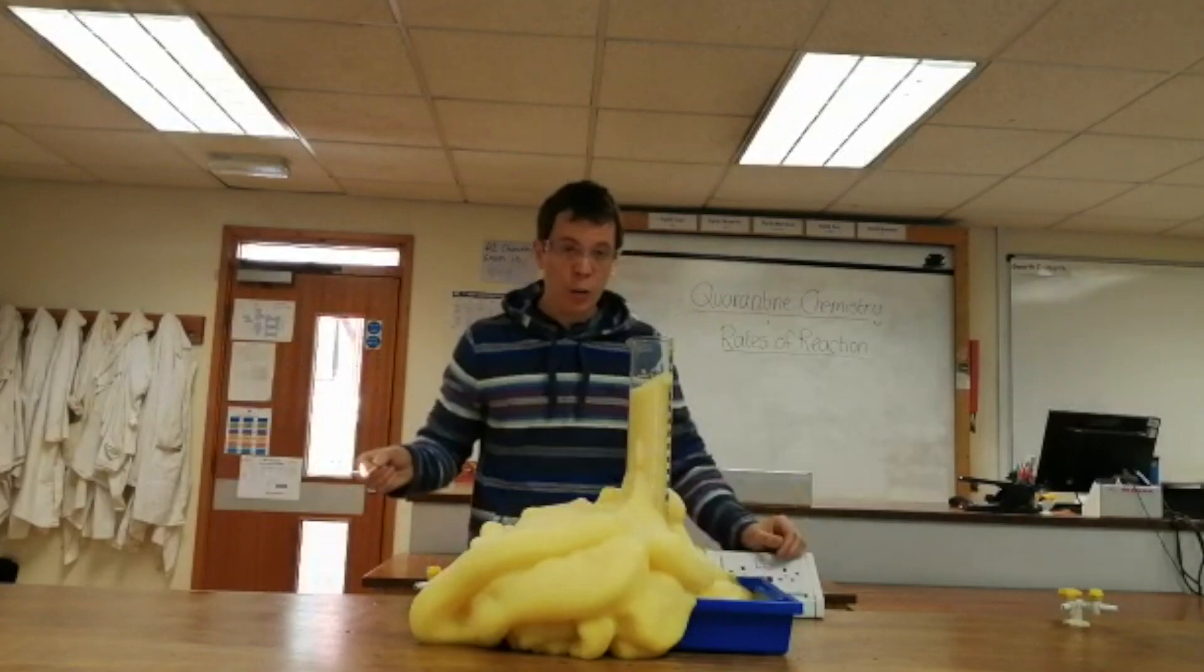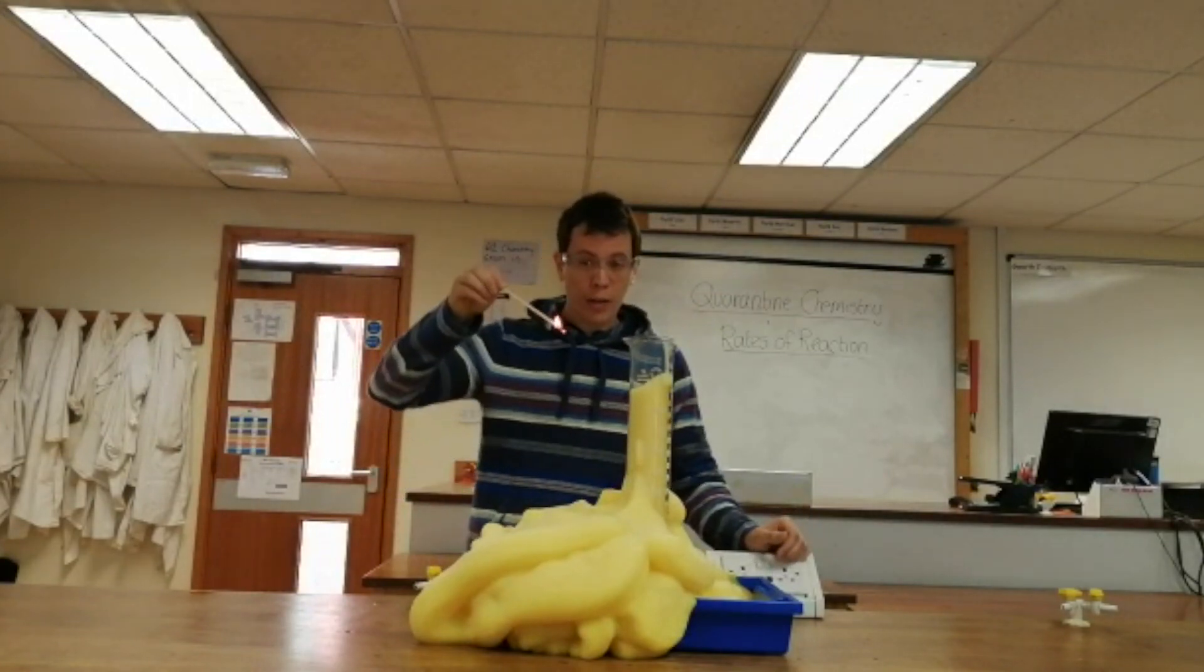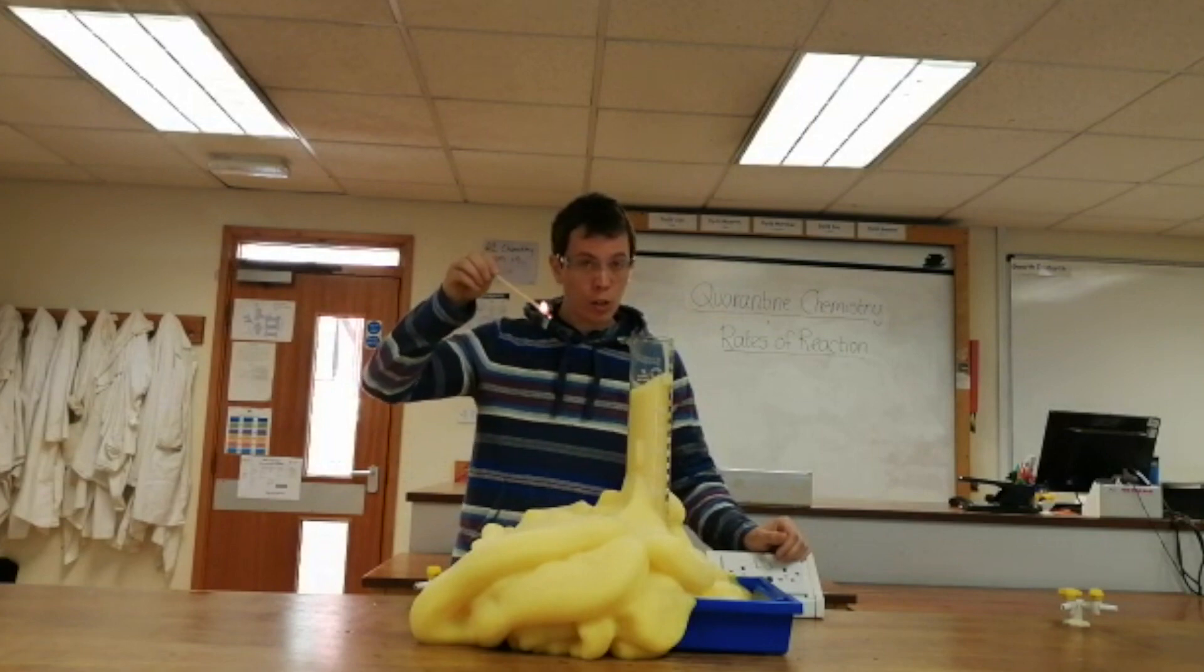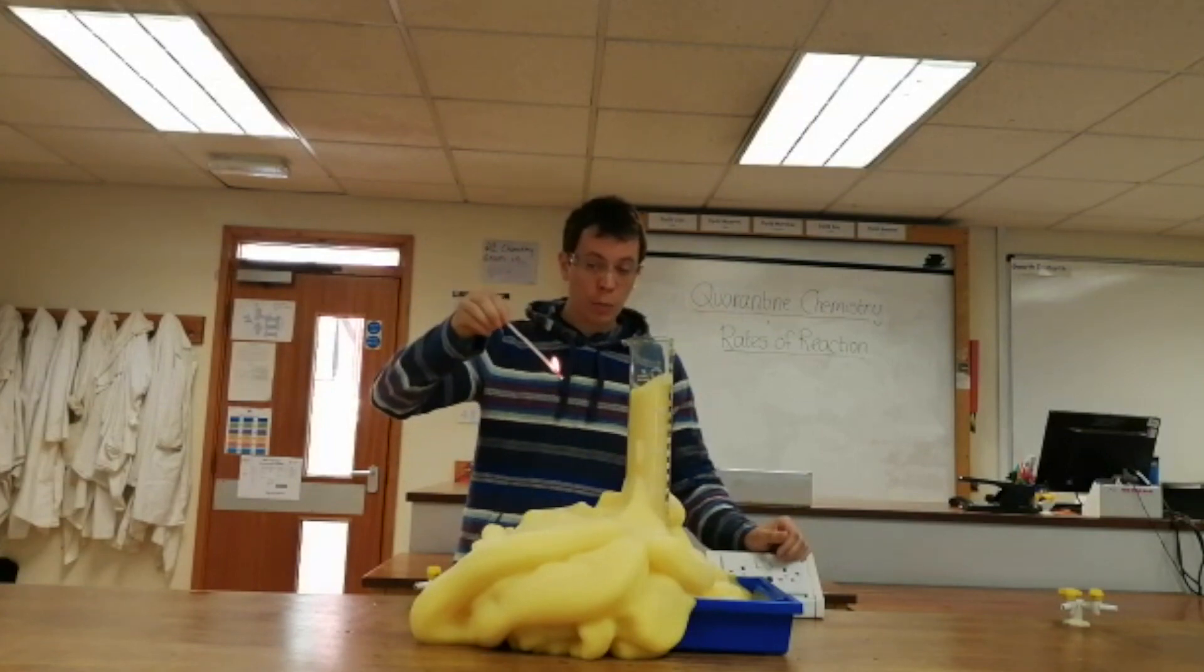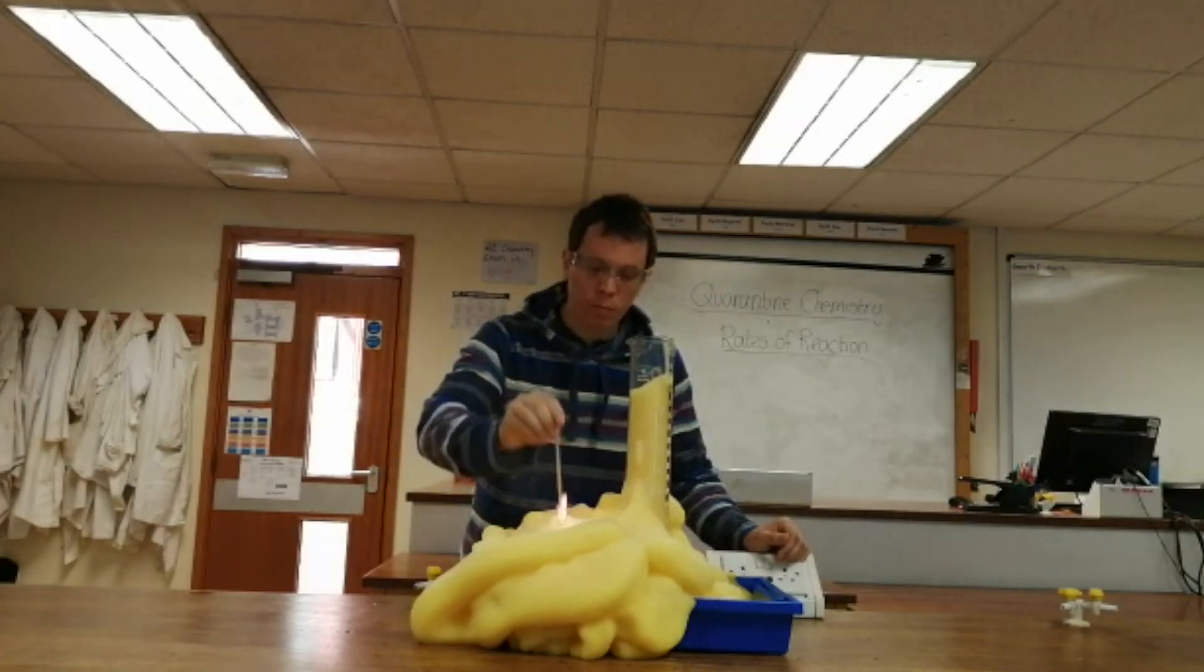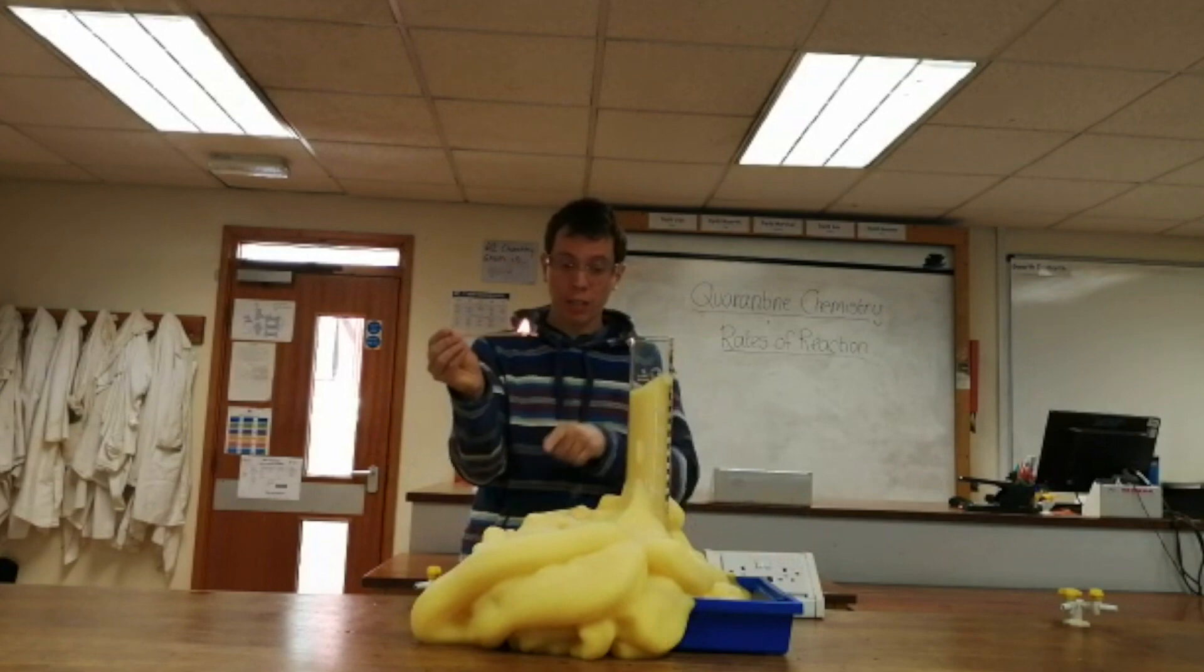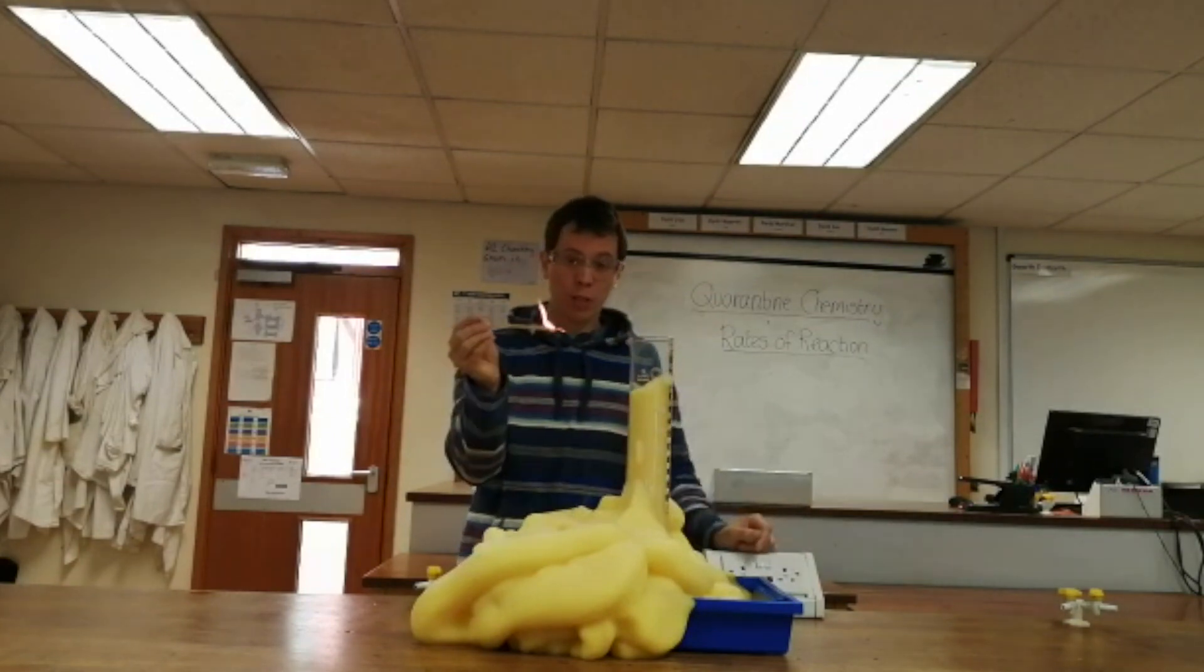Now in an earlier video, we said we could test for oxygen gas, not with a lit splint, but with a glowing splint. So what I'm going to do is I'm going to blow the splint out, stick it into the bubbles and see if it relights. Okay, so my splint has relit, which is a positive test for the fact that the bubbles in here must be oxygen gas.